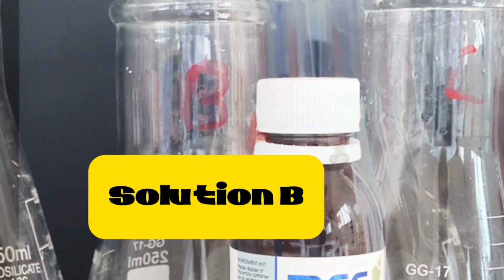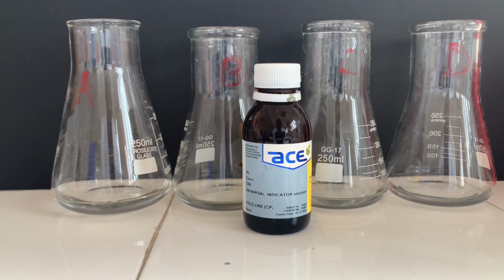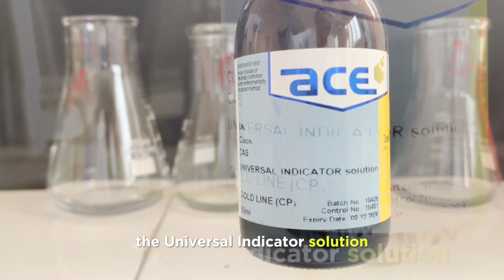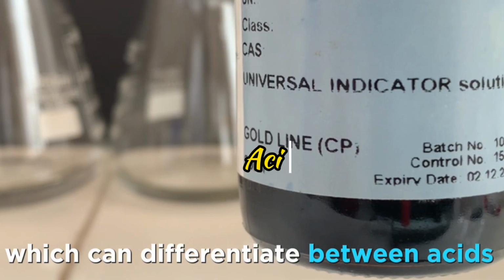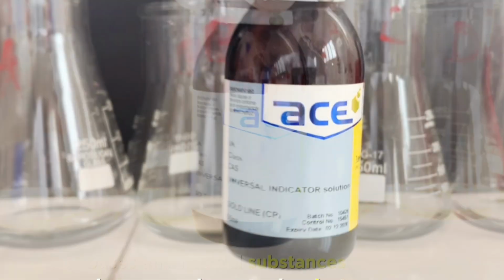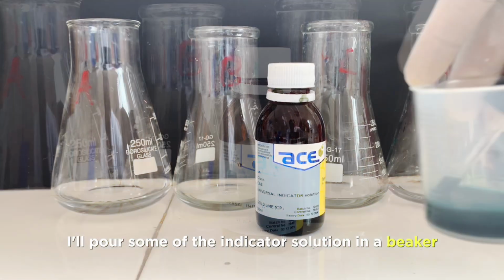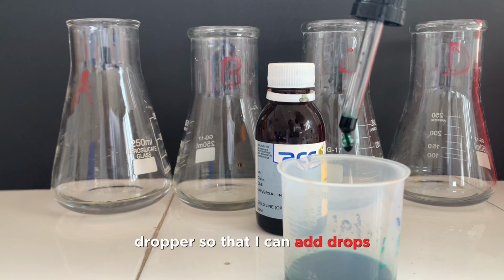I have with me here my 4 unknown solutions which I want to test. I'm going to test for their nature using the indicator which I have here, which is the universal indicator solution. This can differentiate between acids, bases and neutral substances. I'll pour some of the indicator solution in a beaker so that I may be able to use a dropper to add drops of the indicator.